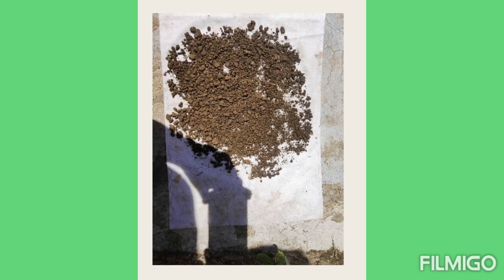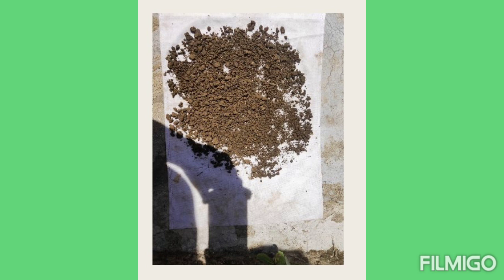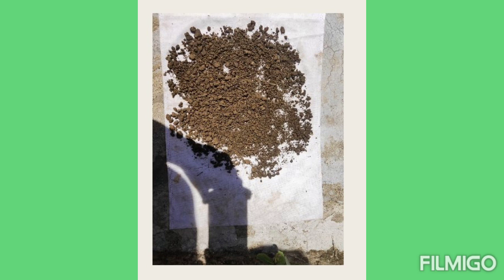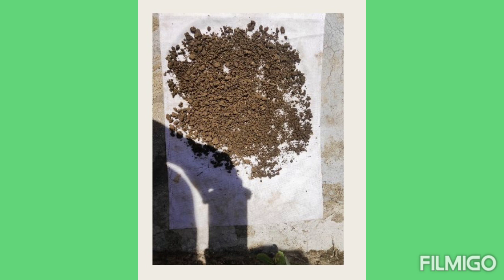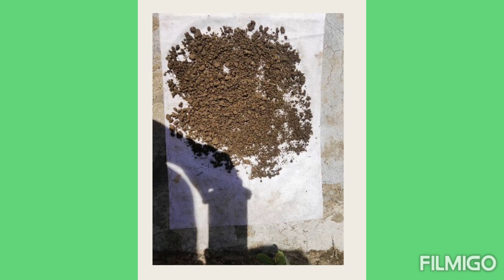Because the moisture content in the soil is much, and if the soil does not have that much moisture content, then we store it in a shed or dry place.